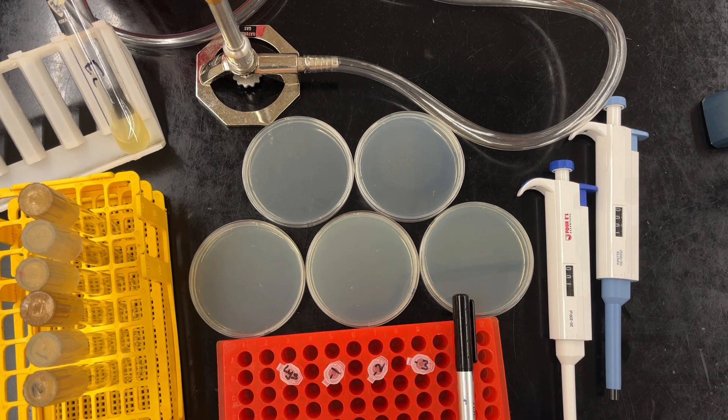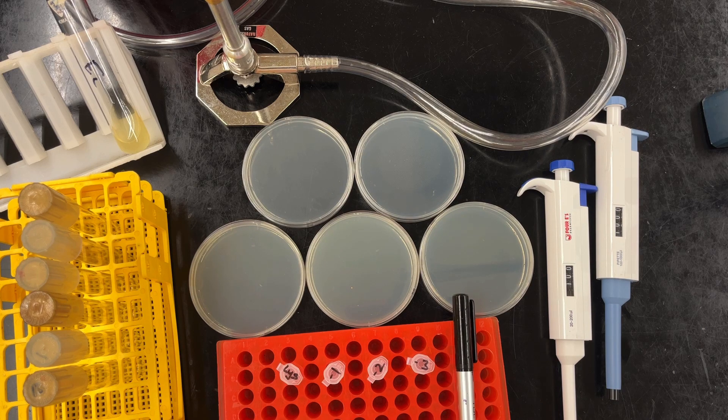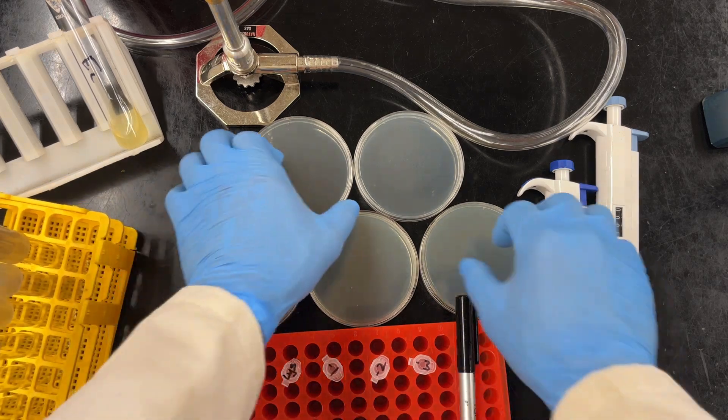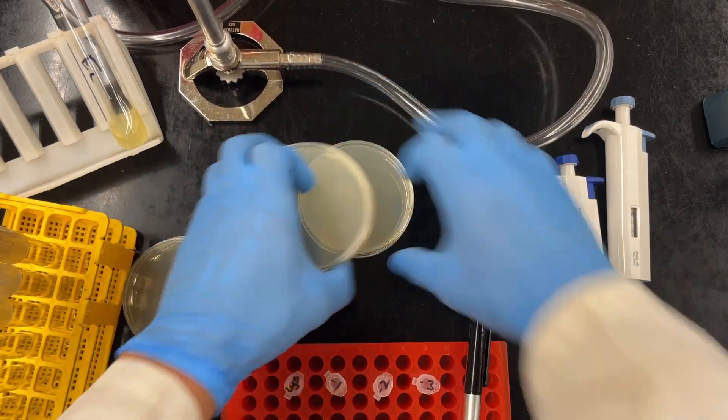As with everything, we're going to need to label, label, label. So I have my dilutions in our small Eppendorf tubes labeled already. And then I'm going to start labeling my plates. But first, I've got to move some things out of the way so I can see.